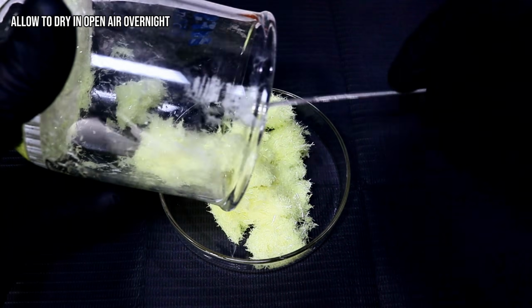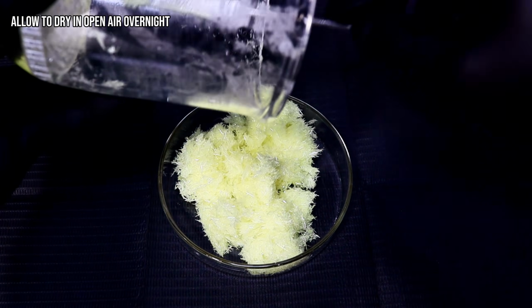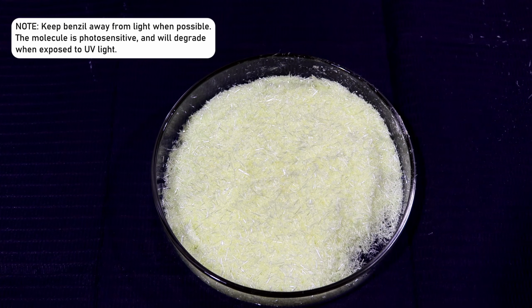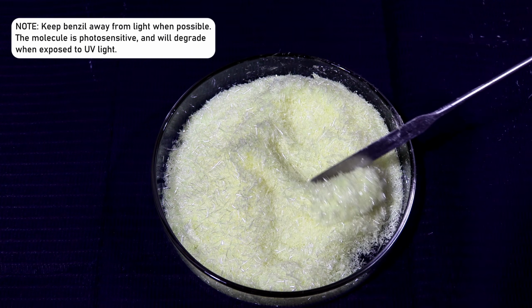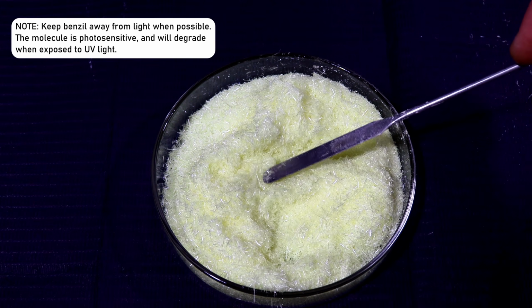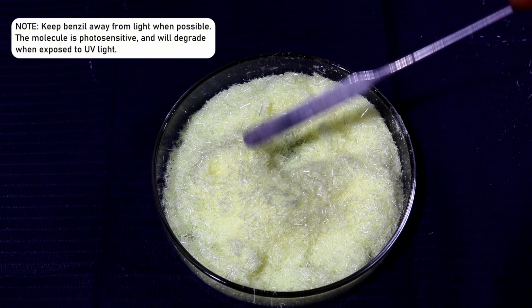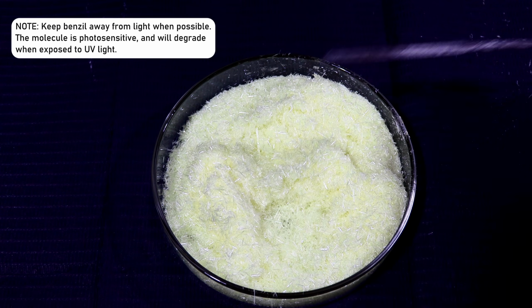After allowing this to dry completely, I was left with these big, beautiful yellow crystals of pure Benzil. I went ahead and weighed these for a final mass of 18.62 grams, which represents an 88.7% yield from my benzoin and a 64.6% yield from the benzaldehyde. The melting point was around 98 degrees Celsius, which is fairly close to the literature value of 95.